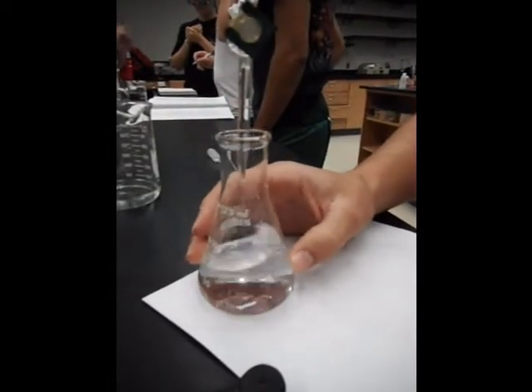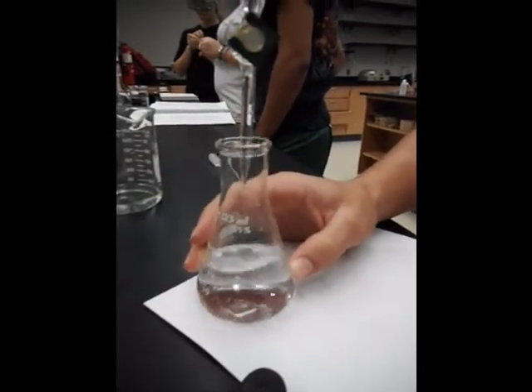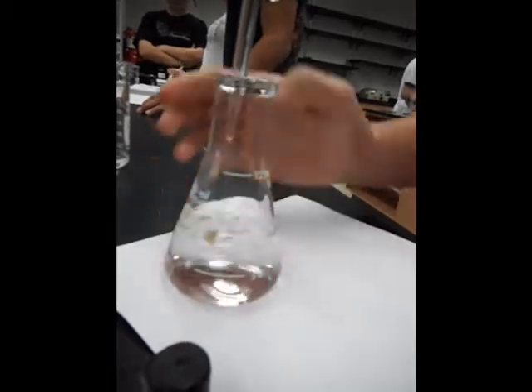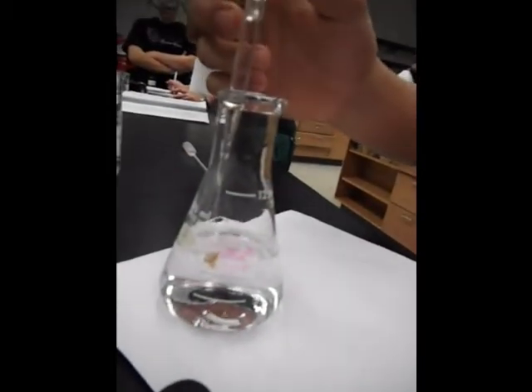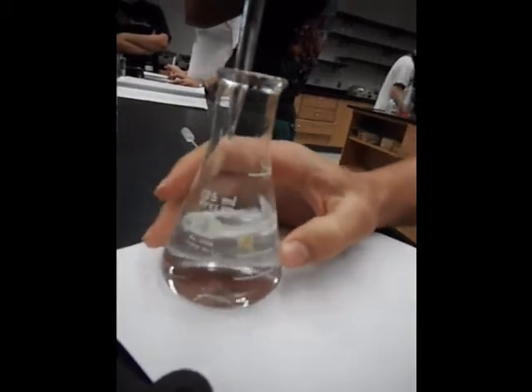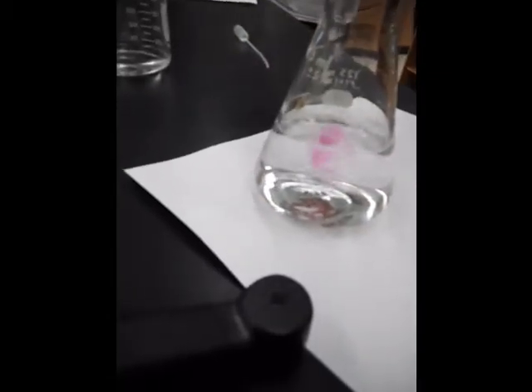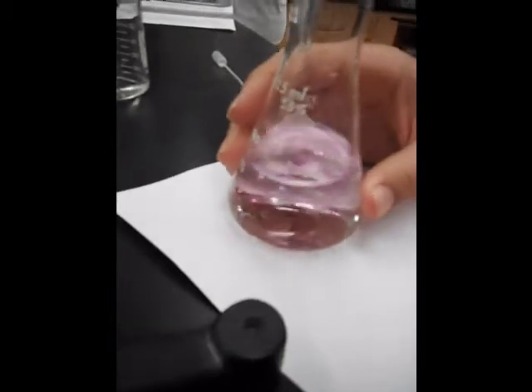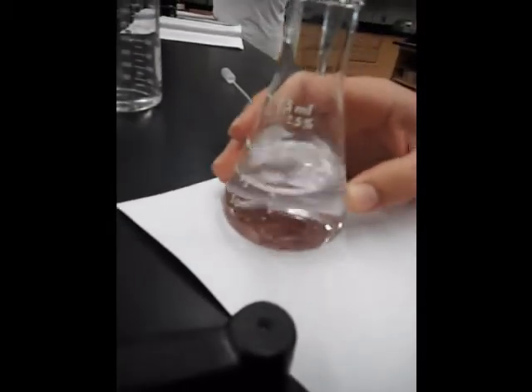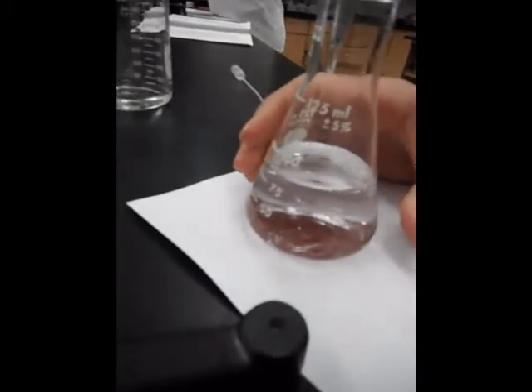The indicator, depending on which indicator is used, you want to use one that doesn't change the reaction, and use the minimal amount you can, but something that also lets you tell what's going on. It can detect the pH, conductivity, or the absorbance, and that's something it can change to depending.